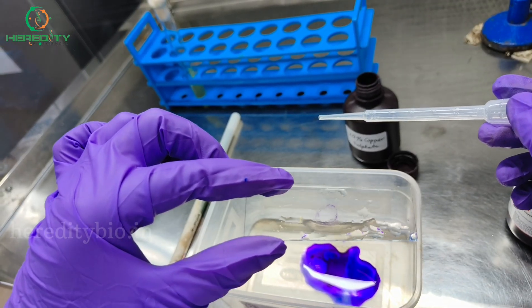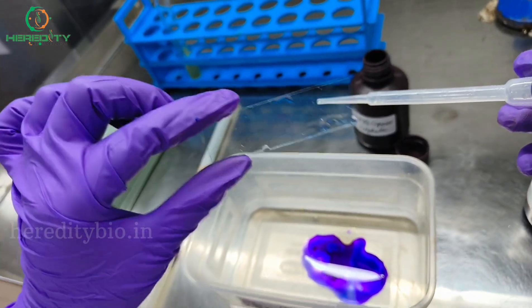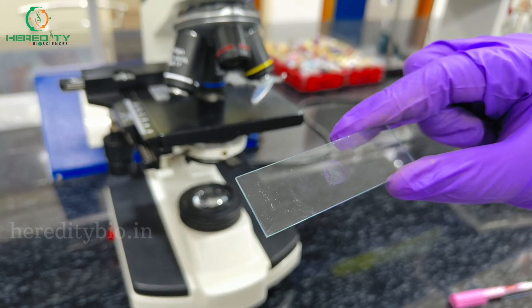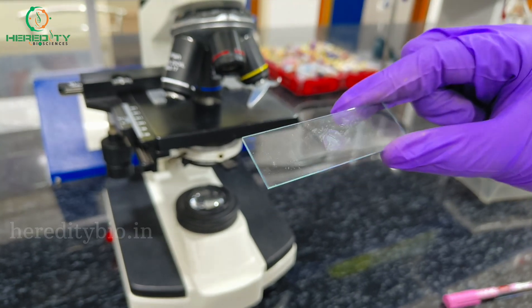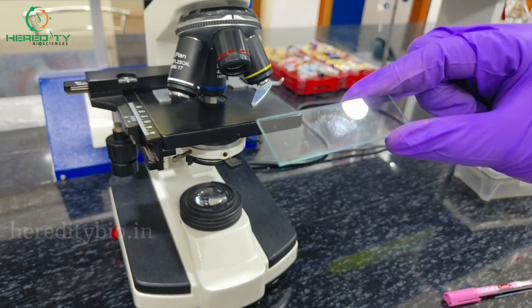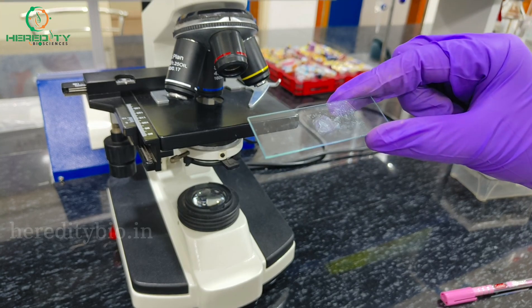Now the slide looks like this. Then we will dry the slide. After it's completely dry, we will visualize it under microscope at 100x power with the help of oil immersion.